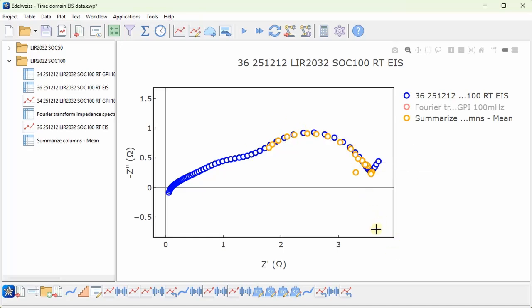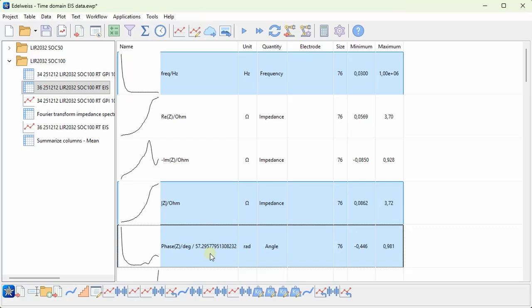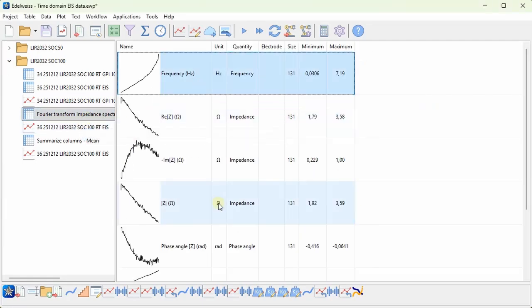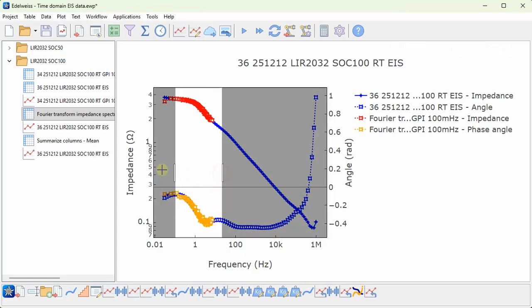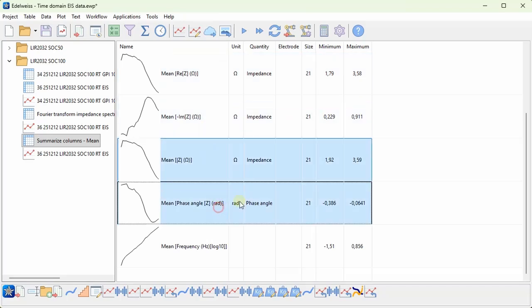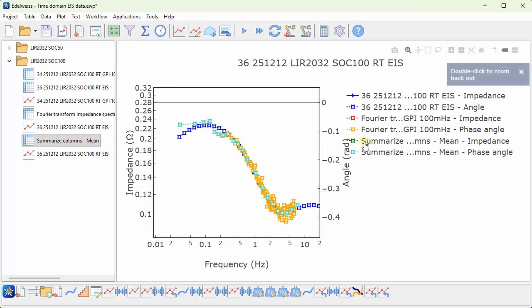Now it might be a little bit difficult to judge how good this overlap is, since we don't have any information about the frequency in this plot. So for completeness, let's just also plot the Bode plot. I'll select the frequency, magnitude, and phase, and then I can choose the Bode plot. And let's now add the calculated spectrum. So we see that also the frequency overlaps quite well, just that we have quite a bit of this noise. So if I add my smooth data, frequency, magnitude, phase, drag it to the plot, we can again see that the overlap is pretty good.